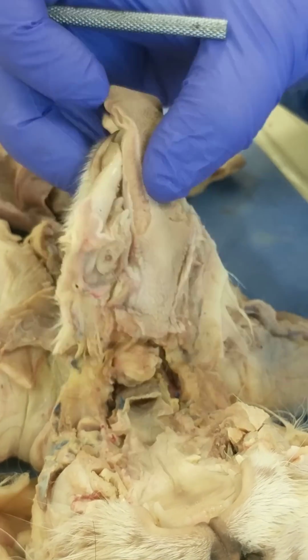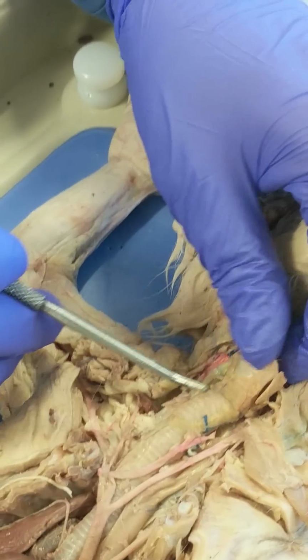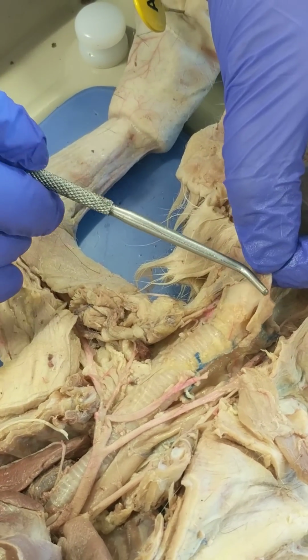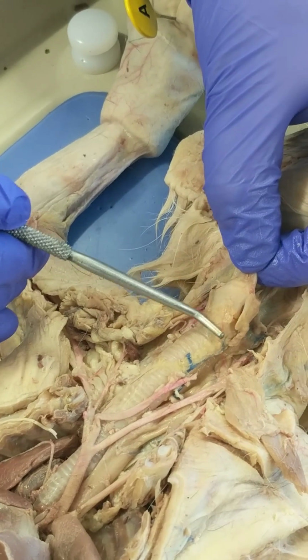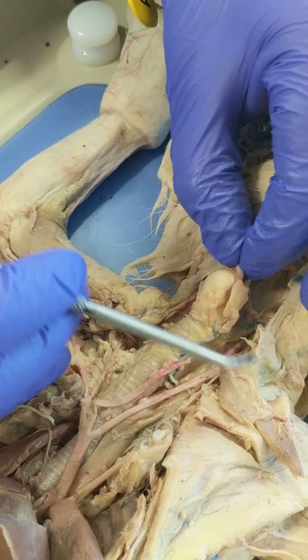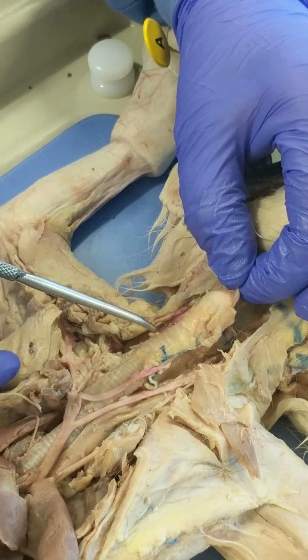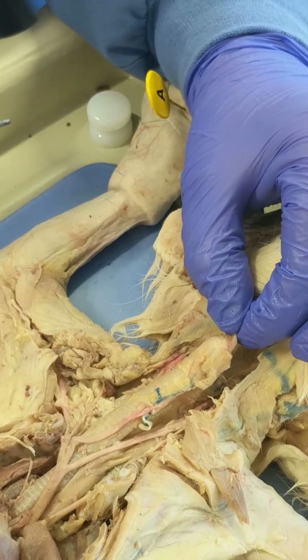Okay, let's look at the larynx in a little bit more detail here. The larynx is made up of several cartilages. The epiglottis is also a cartilage, but the prominent one here is called the thyroid cartilage, and beneath it is the cricoid cartilage. So that makes up the larynx. On either side of the larynx, we should have been able to find thyroid glands, but they've either been removed or were very insignificant in this cat, so you can't see them.